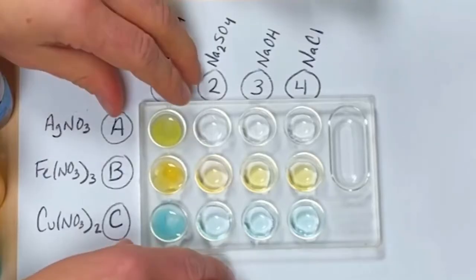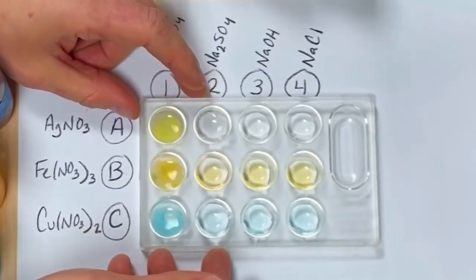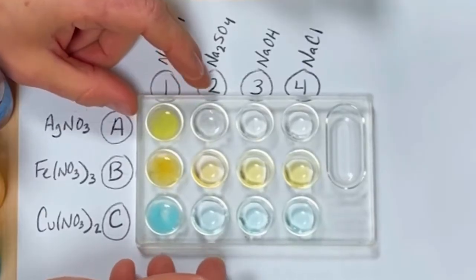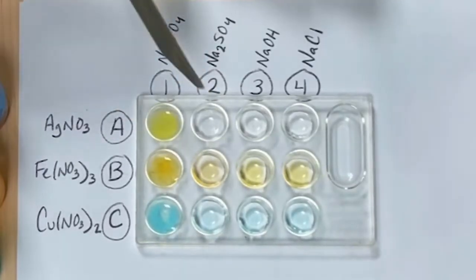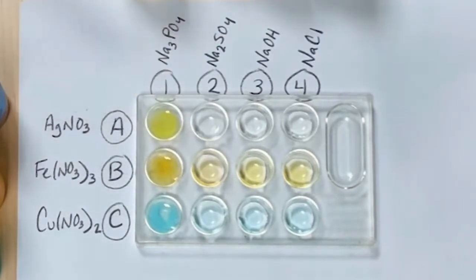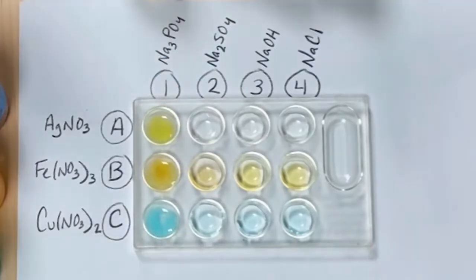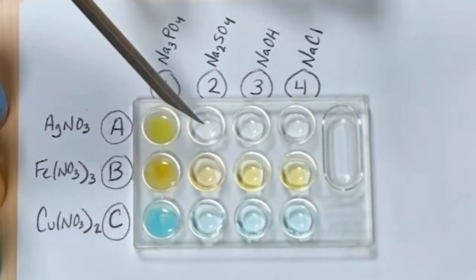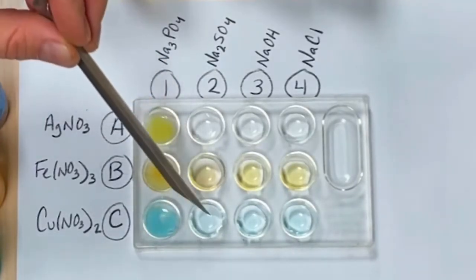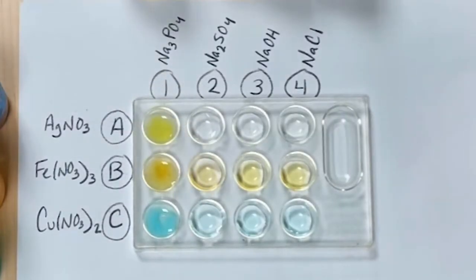Sometimes after a reaction happens, it's good to shake it around on a white piece of paper to see if anything formed. But it doesn't look like any compound formed in any of these. So for these reactions, I would say there are no visible reactions, at least for now. Maybe in a few seconds it'll take time, but overall it looks like nothing happened or formed.